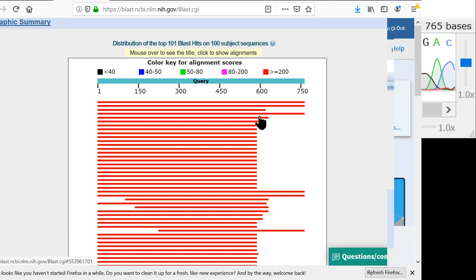Usually when people sequence mushrooms, they use a primer called ITS4 as the reverse primer. ITS1 and ITS4 give you about 600 bases. So these sequences here are the ones that used ITS4, because it stopped copying at base 600. Now I used ITS4B, so I get a little bit more data in here, and it stopped copying over here.